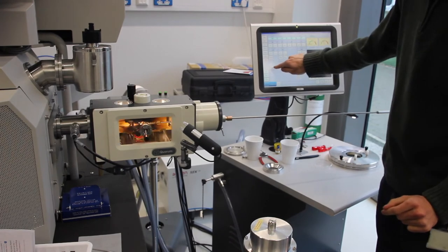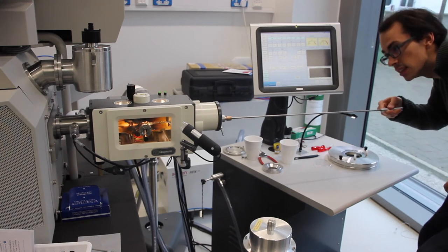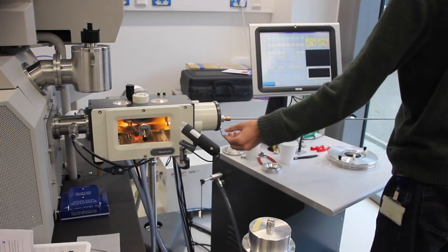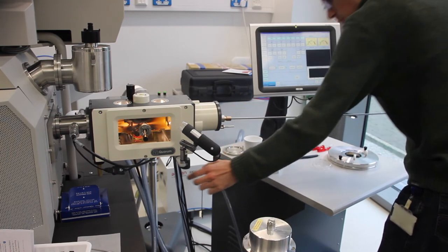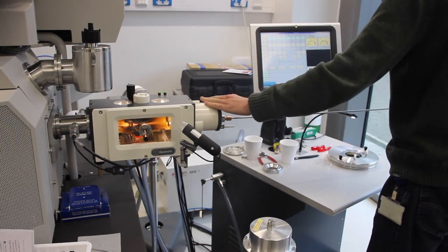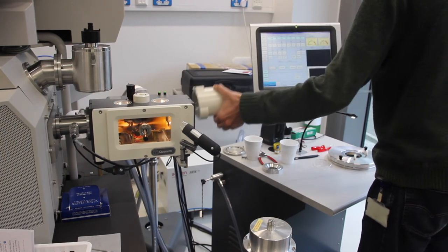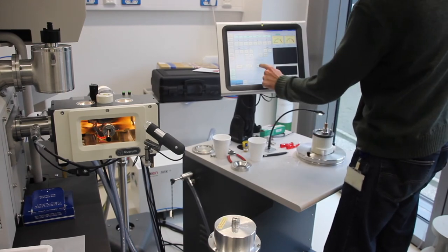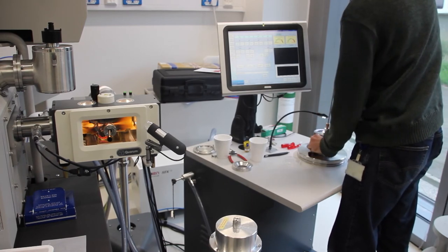We're going to turn our prep lamp back on, that goes off on a timer. What we're going to do now is we're going to retract the shuttle into its little home in the transfer vacuum here. We're going to close this valve, isolating the shuttle in this area, and then we're going to close this valve over here. Now with the shuttle protected, we're going to press and hold the vent button until we can remove this. Bring it over to this well and press slush pump, so we want to reintroduce a vacuum to this area before the shuttle passes through to liquid nitrogen. Again, about 10 to 15 seconds, which will allow a vacuum to form but not for the liquid nitrogen to freeze.